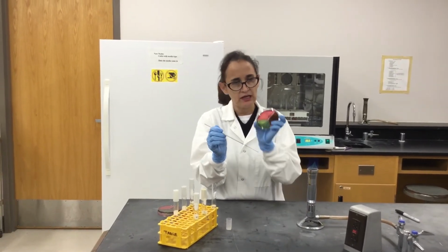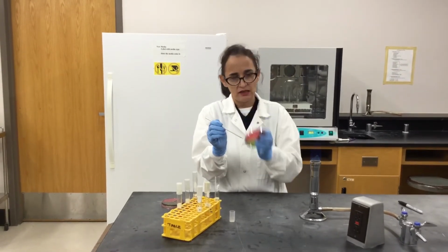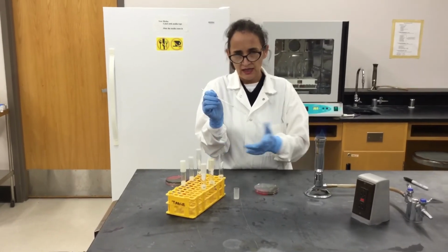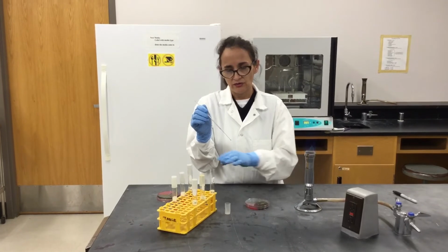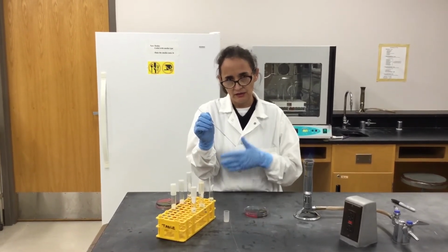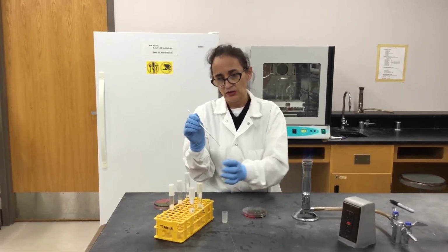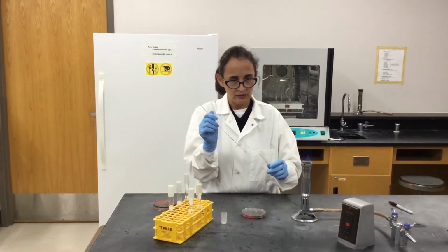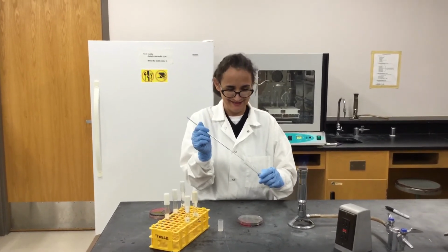So the first one that I inoculated was MSA, and then I'm going to do EMB, and then citrate, and then this one. And I think that in order to prevent this video from being super long, I'm just going to do the rest of the video. But after that, and once we have the results, I will make another video showing you the results for all the 3 bacteria. Otherwise, my camera person is going to be all mad.